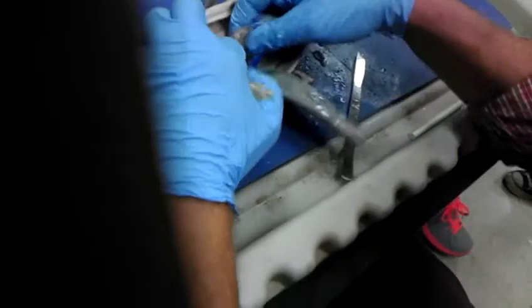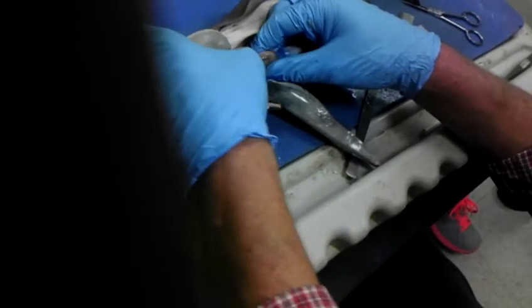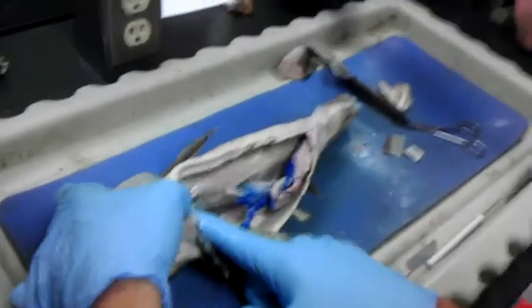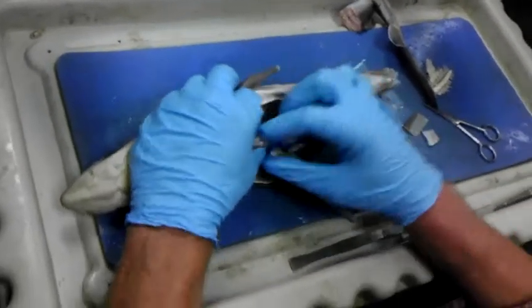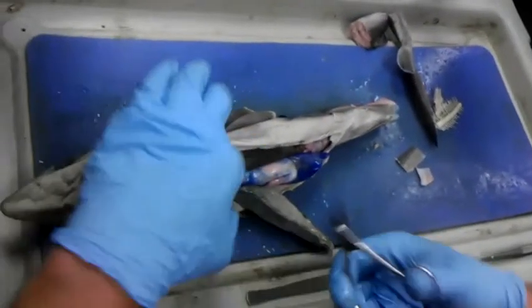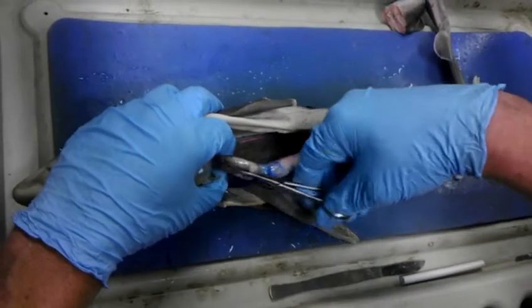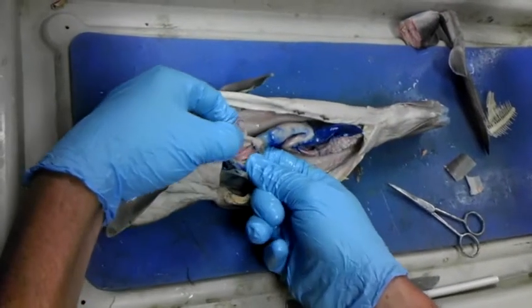So as food comes in, it goes into the stomach region. So it goes in from the buccal cavity through the esophagus and into the stomach. The stomach is separated into general portions, the cardiac, which is the upper region, and then the lower pyloric section. If we cut open the stomach, we will expose the folds, internal folds within it.